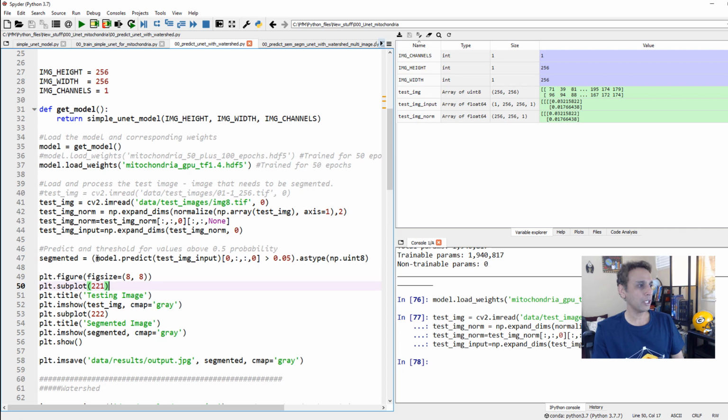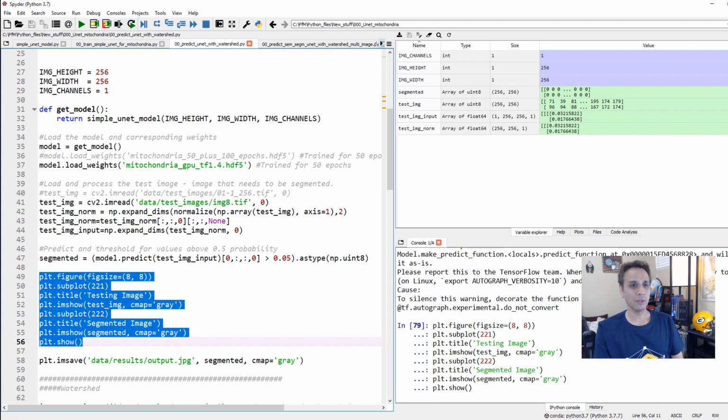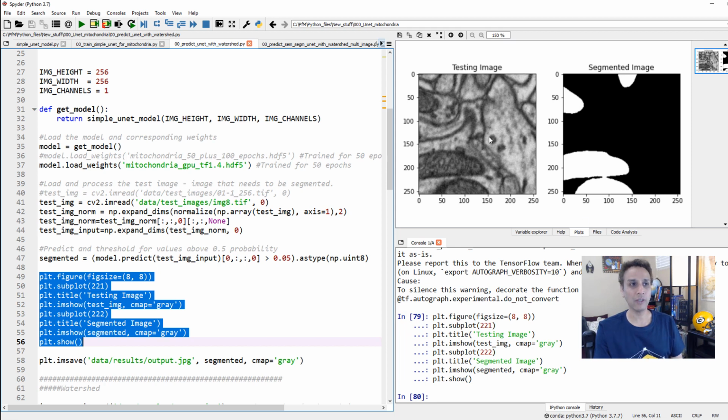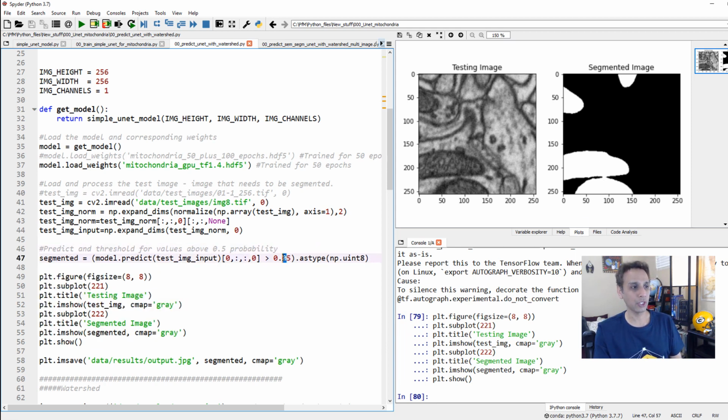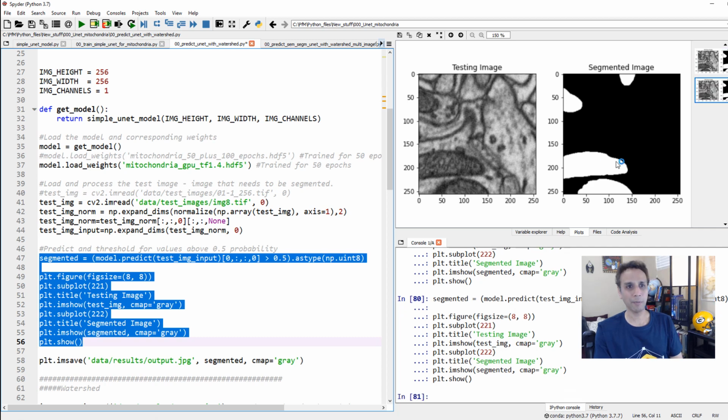Once you are done predicting, go ahead and threshold it by showing me all the pixels above a value of 0.05. Let's actually run this line so you can see exactly what we mean. Now that it's done predicting, let's go ahead and plot. This is exactly the stuff that we did in the last video. You see how these are touching, and that's the reason I changed this to 0.05. In fact, if I put 0.5, our model is doing such an amazing job separating these two that there is nothing to show in this video if there is nothing touching. That's exactly why I'm changing this to 0.05. I intentionally make this a bit not as good, and now you see these two are touching. So if I do object analysis, these two would be considered one single object.